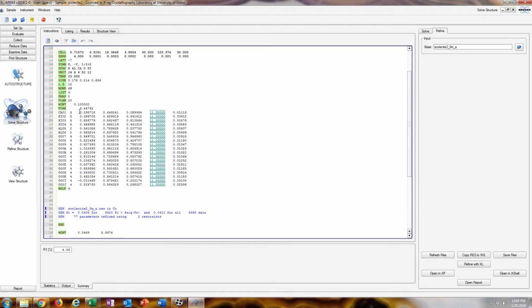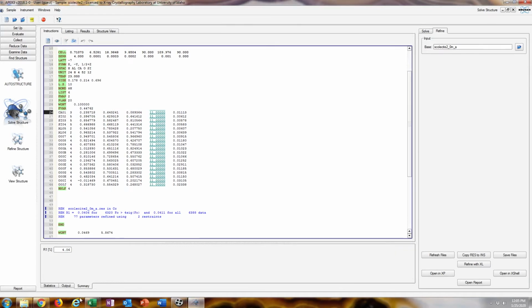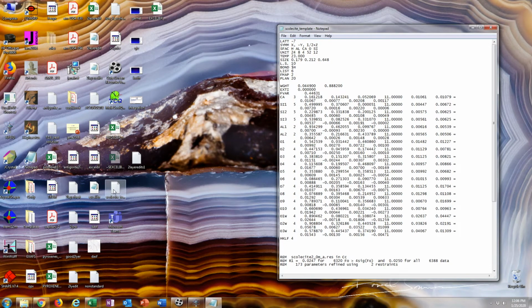Sometimes if you have magnesium or something in the structure, it'll mix that up with a calcium, and that is pretty obvious. Mg-O should be about 2 angstroms, Ca-O is about 2.3. And then here, since I'm pretty sure that I put this in the convention that they are using in this publication, these waters are just going to be oxygen atoms, and I'll attach some hydrogens later. Since I'm pretty sure that I got that figured out, I like to prepare these files, these templates, so that I can just paste them into the structure and not have to think. But I'll run through this example just to show a pretty basic refinement. I'm not an expert on refinement by any means, but I'm good enough to get this done.